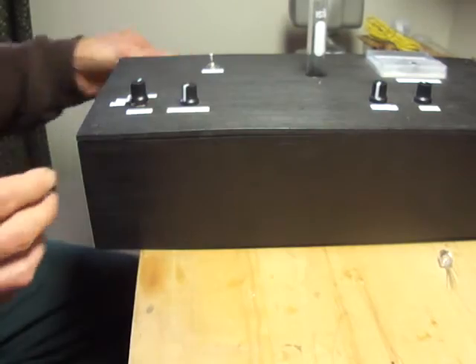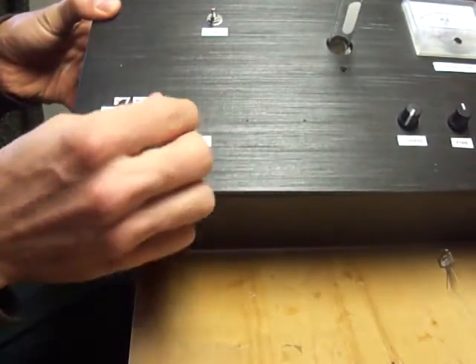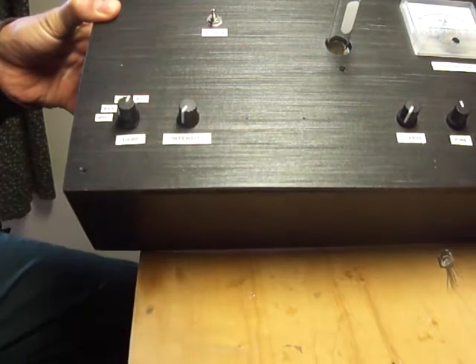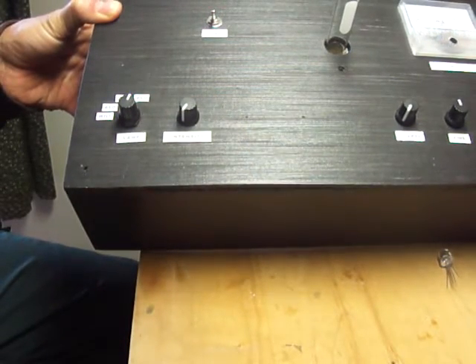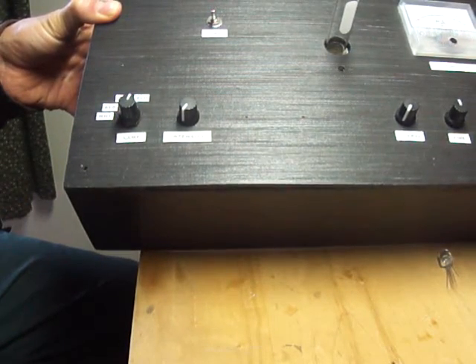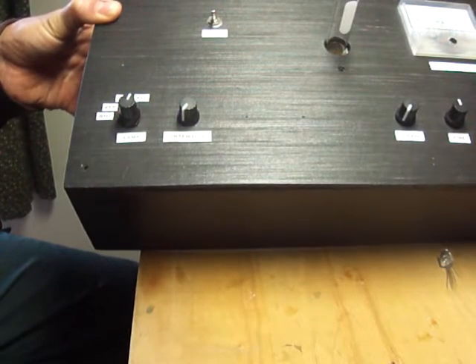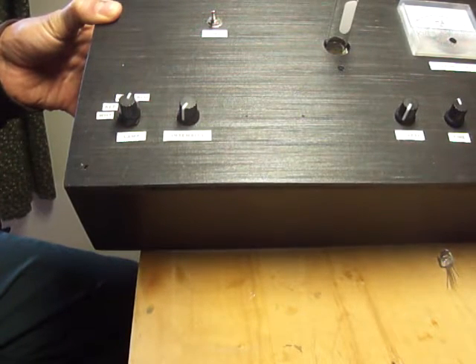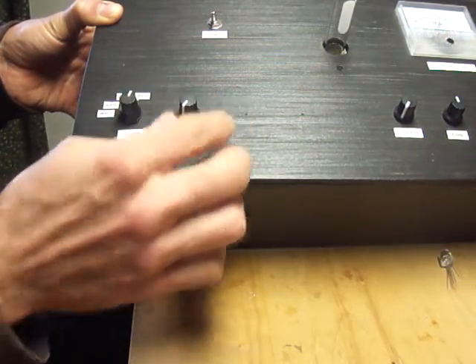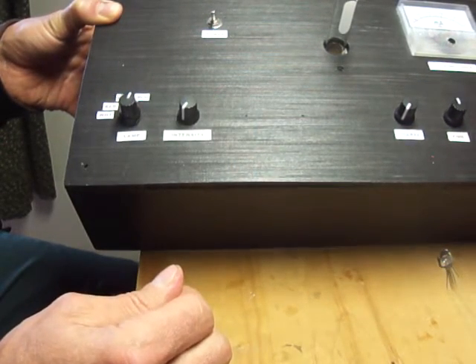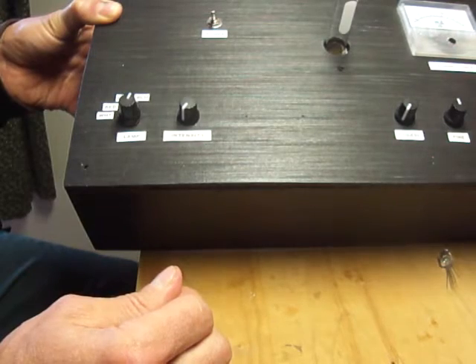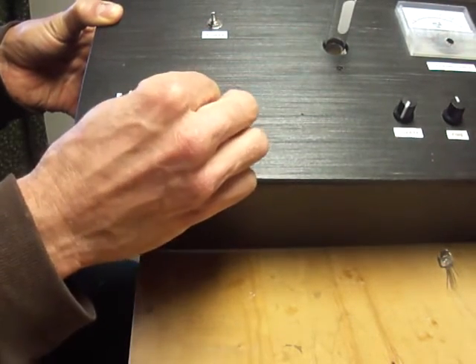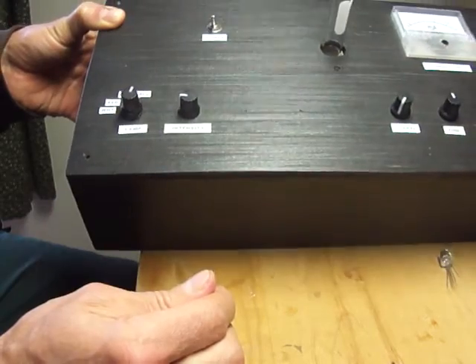I also have an intensity switch here which will turn up and down the lamp. If you have a fairly weak series of solutions that you're looking at and you want to use the full range of the detector, you might want to tone that down. Conversely, if you have a very dark solution, you might want to crank that up.